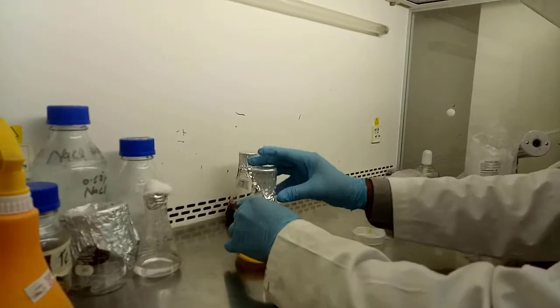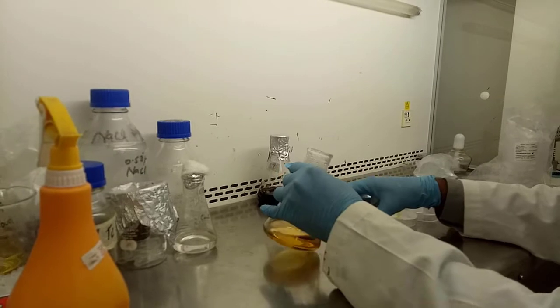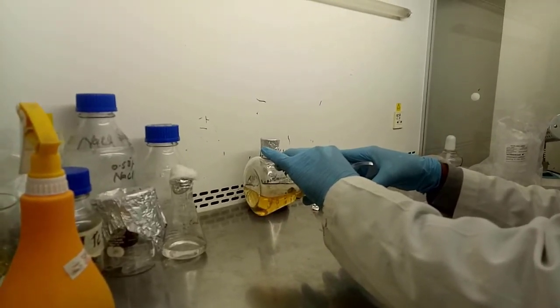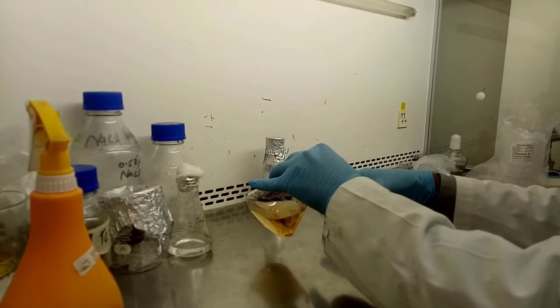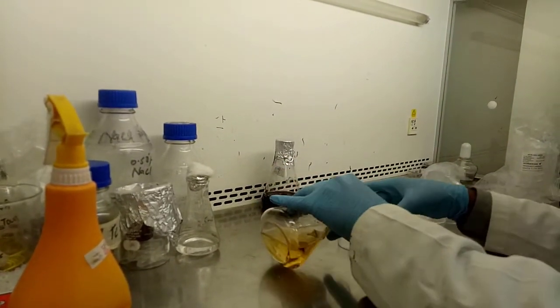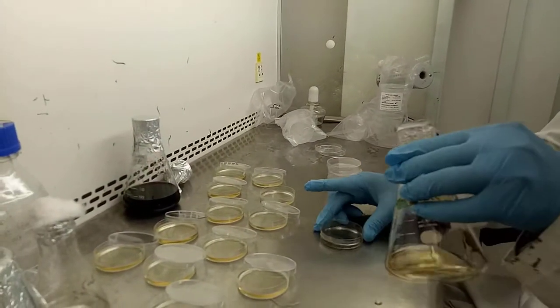After that we will shake the media. If it is at normal cool temperature, then pour it properly into petri plates, otherwise it will leave the agar media at room temperature. For E. coli culture, we will use a specific agar like TBX agar.